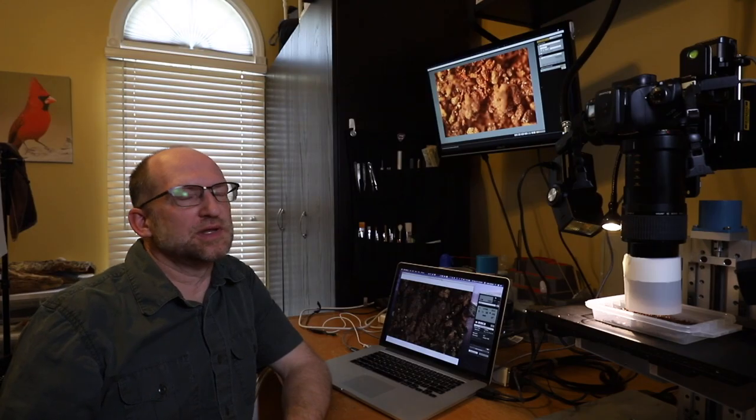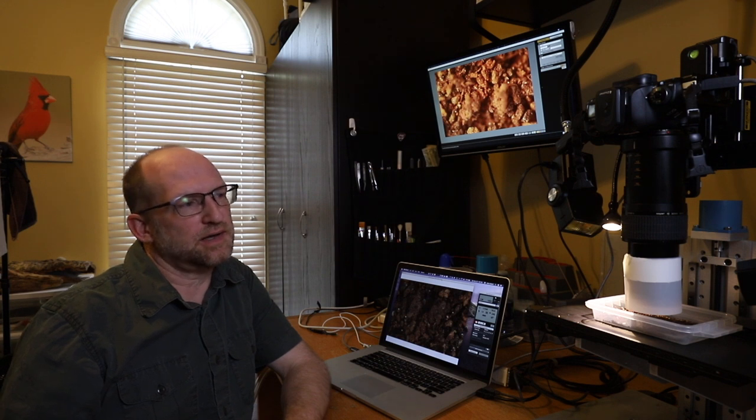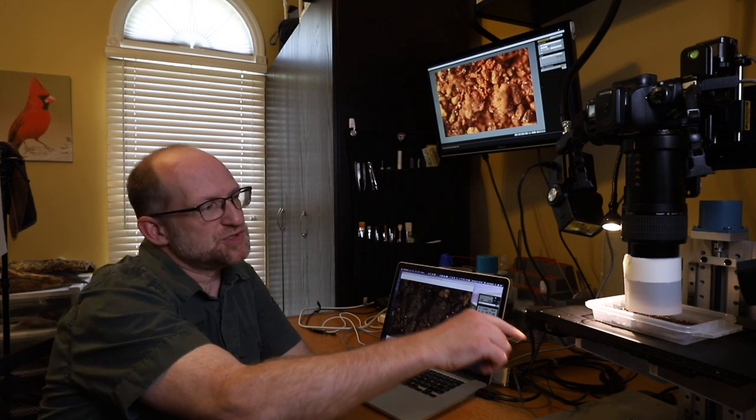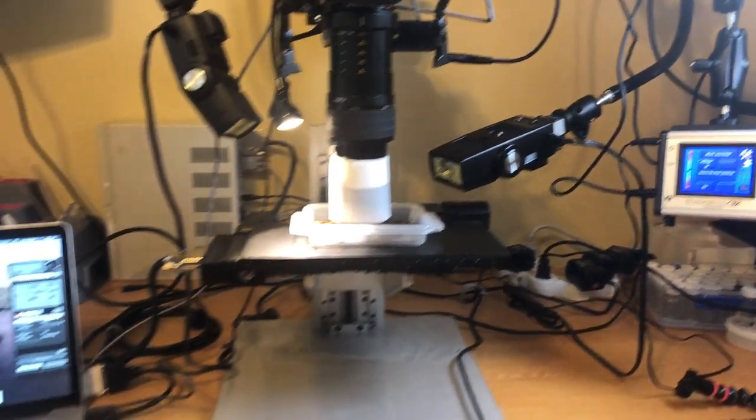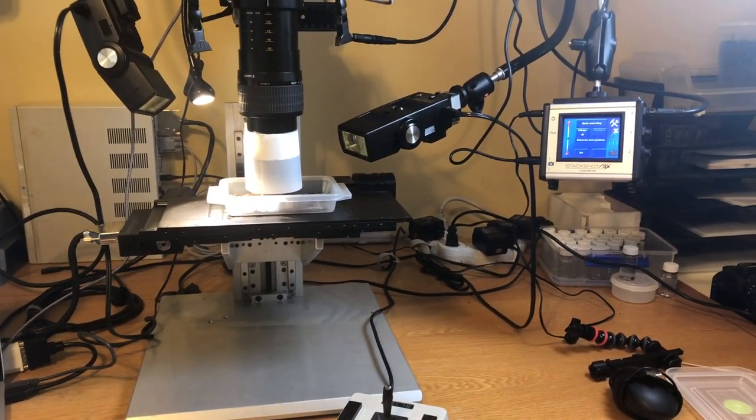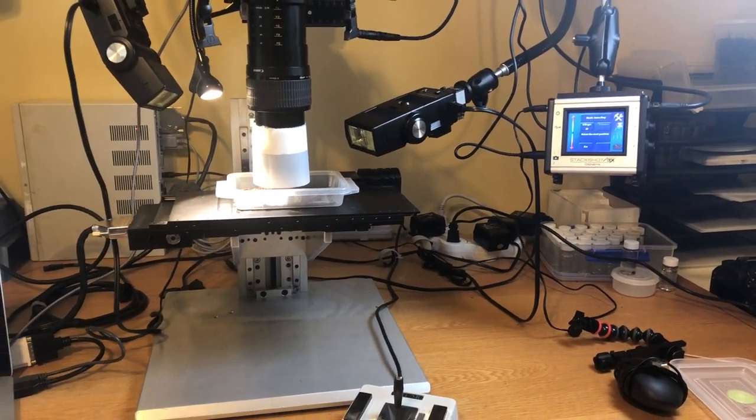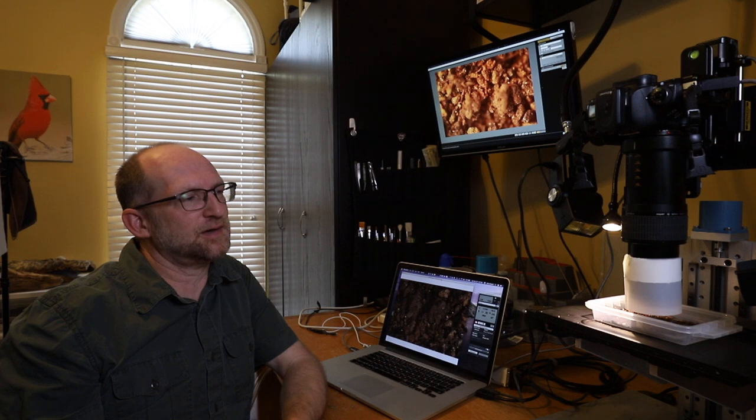I was fortunate enough when we lived in Austin to have a photography friend that had acquired a ProScan 2 prior XYZ stage, which is what you see right here mounted on a frame. It didn't work and he just gave it to me. I got it working and that's what I'm using here. You can probably get these or something similar on eBay or something like that.